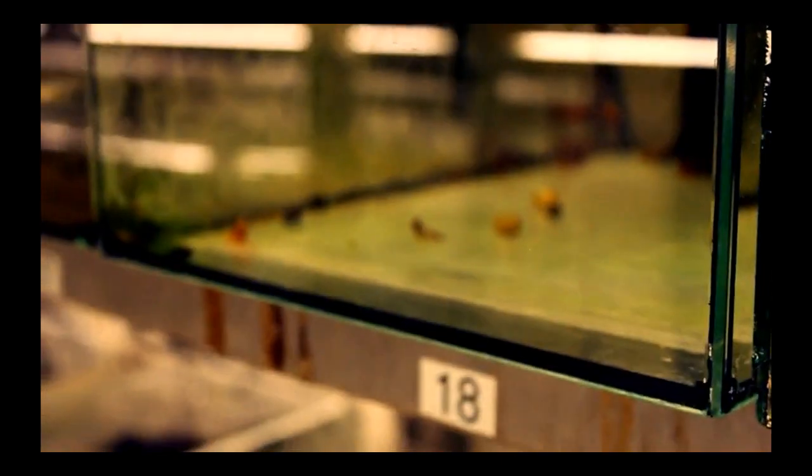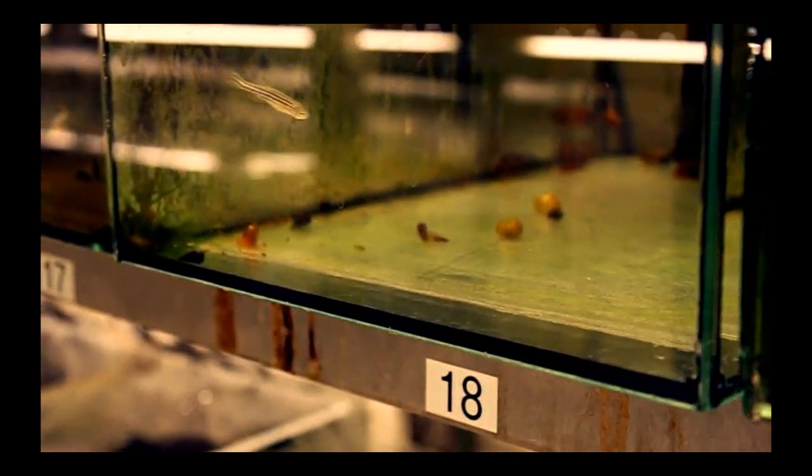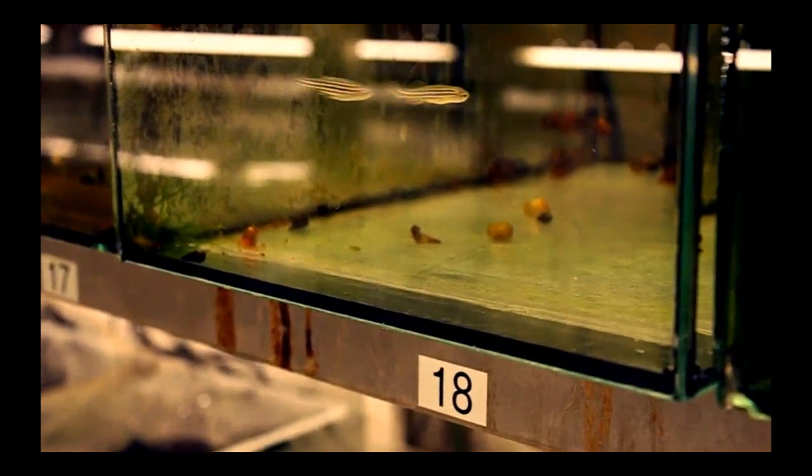Several different mutations affecting the human cardiovascular system have been discovered by the analysis of their orthologs in model organisms like the zebrafish. Many developmental and physiological processes could not have been described without the observation of disruption phenotypes following the generation and isolation of mutations.